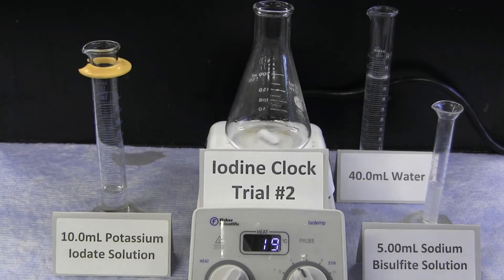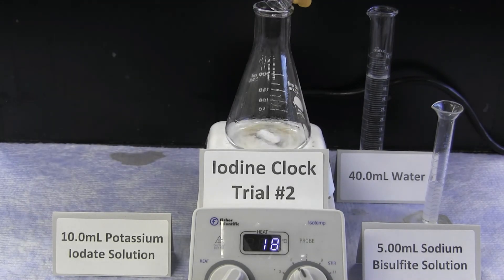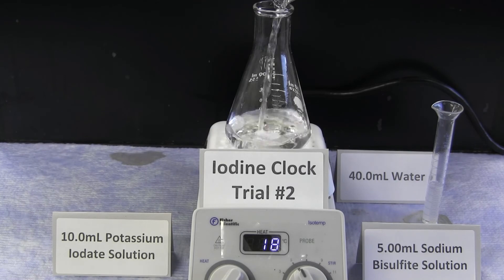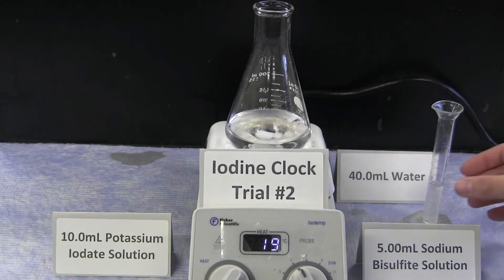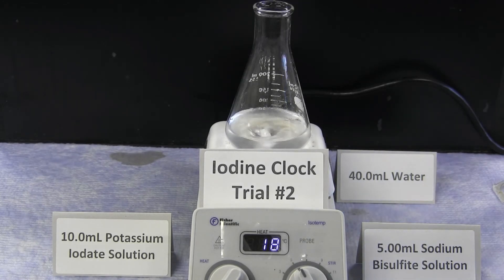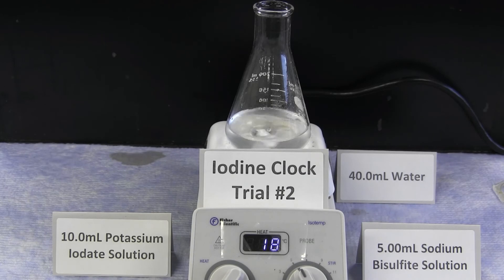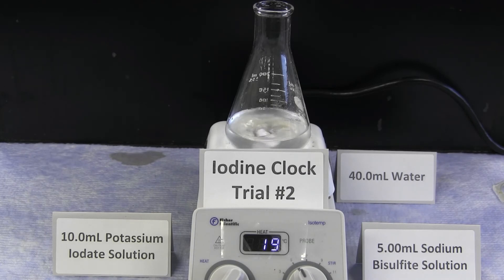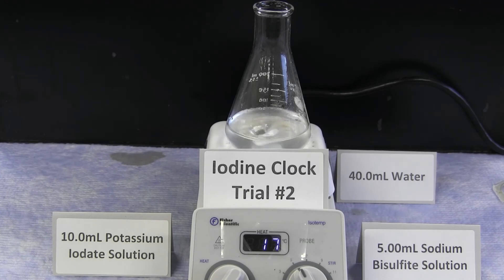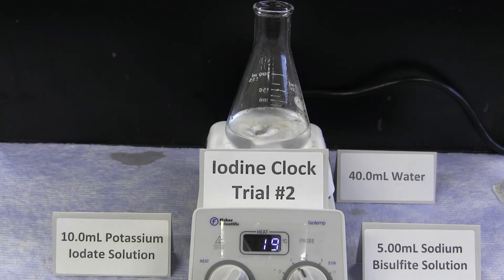The second trial of the reaction again uses 10 milliliters of potassium iodate solution, 40 milliliters of water, and 5 milliliters of sodium bisulfite solution. The final volume of 55 milliliters has been held constant throughout the reaction. The only difference has been the changing concentration of the starting potassium iodate solution.